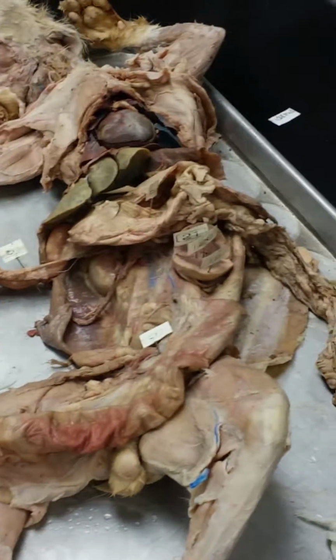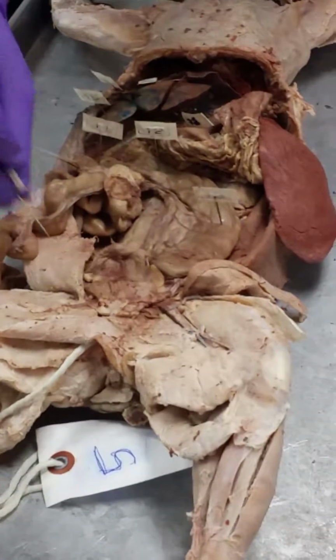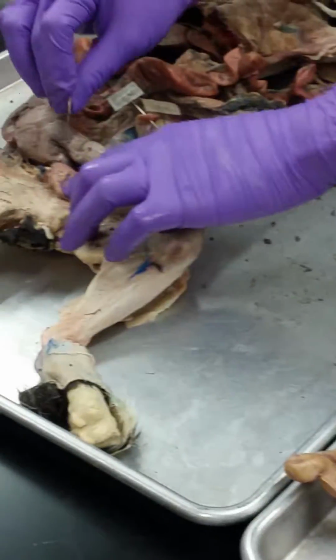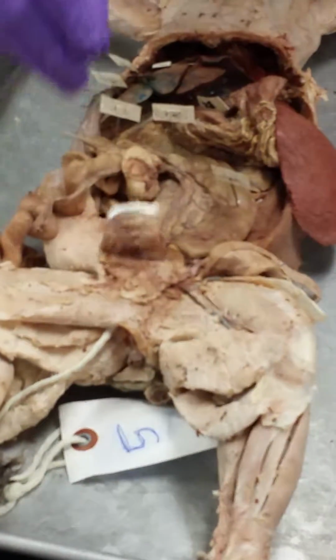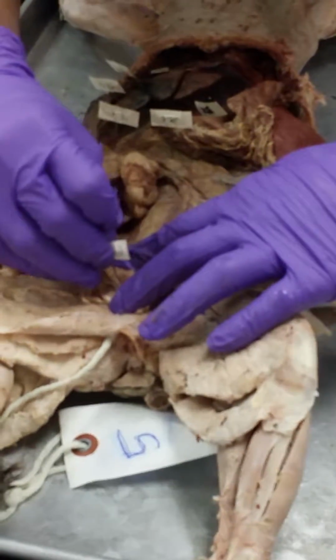Urinary bladder. Okay, we're 22. Urinary bladder. And this is a real nice one to see right here, this pouch. Urinary bladder. Or same thing over here. Urinary bladder. Okay. Stay in place. Just stab it in there.